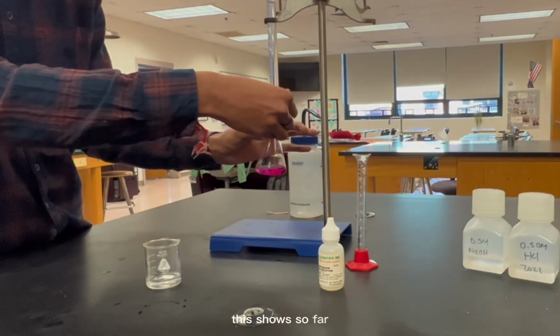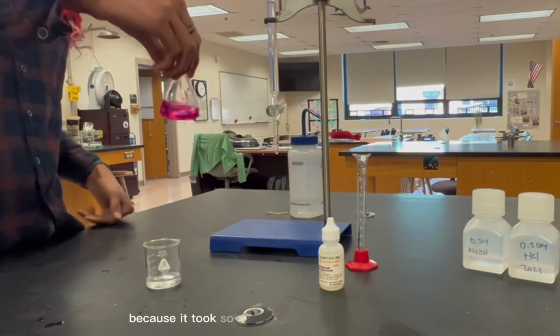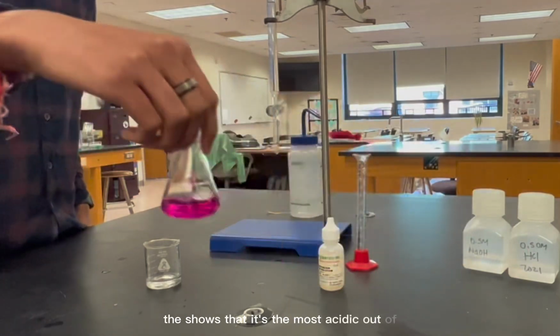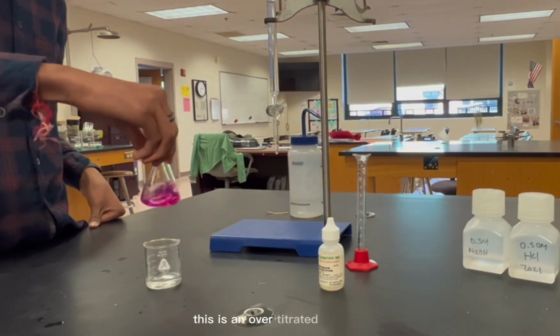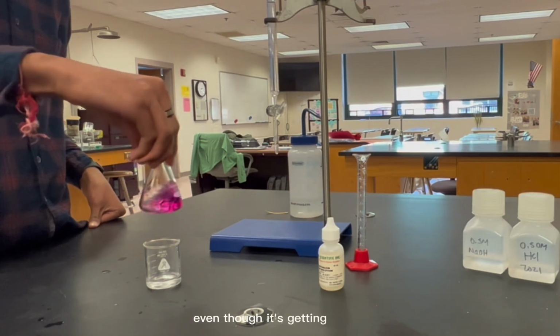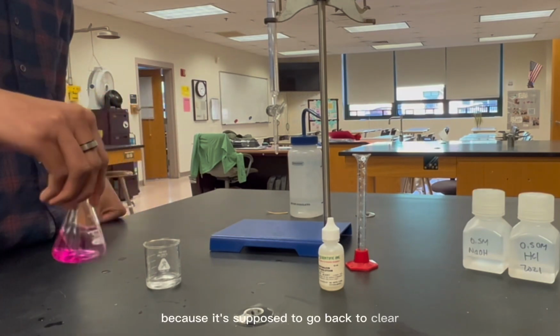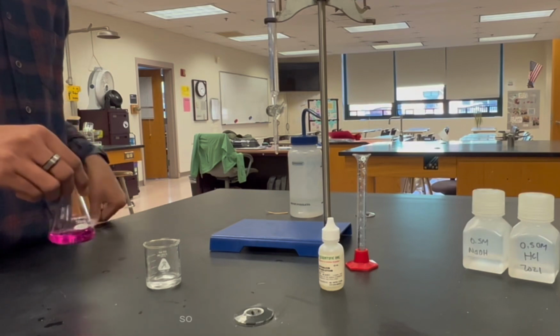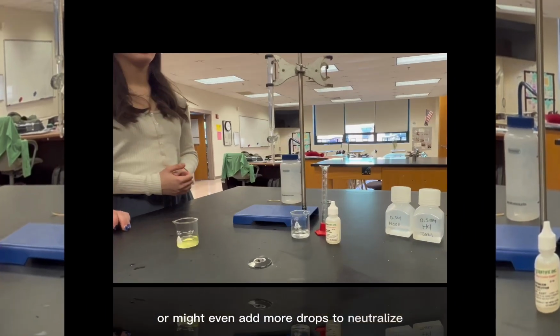This shows so far that sparkling water is the most acidic out of all. Because it took so many drops of NaOH to neutralize, this shows that it's the most acidic out of Sprite and Polar. This is an over-titrated solution because it has a very dark purple color. Even though it's getting lighter, it is still over-titrated because it's supposed to go back to clear. Now remember that we're using 0.5 molar of NaOH, so we might be off by a couple drops, or we might even add more drops to neutralize.